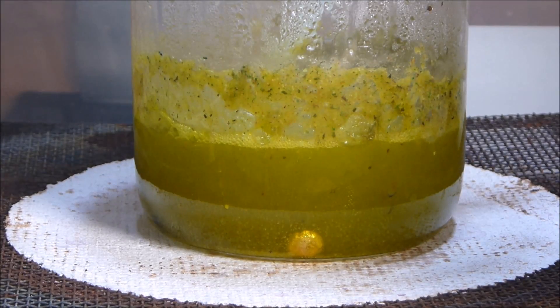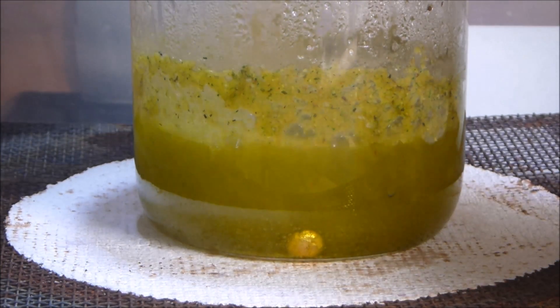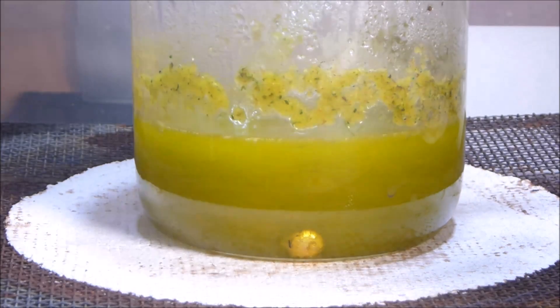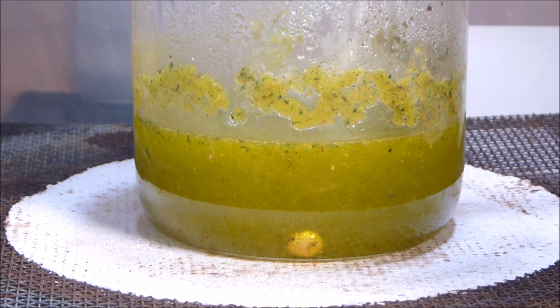So now if I put it in — see the violent reaction — that's only about one little tap so most of it is still on the spoon. Once you get a little bit of a reaction like that, you wait for it to die down and then give it a stir. When you stir it, sometimes you will get a secondary reaction. Be very gentle with your additions. Now let's just wait a little bit and keep an eye on that gold button.